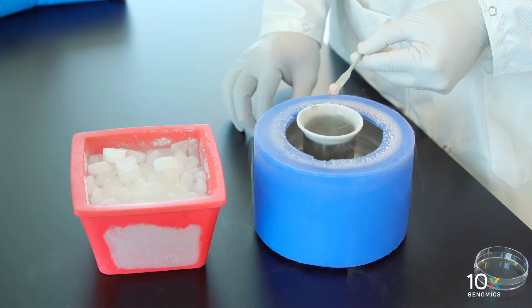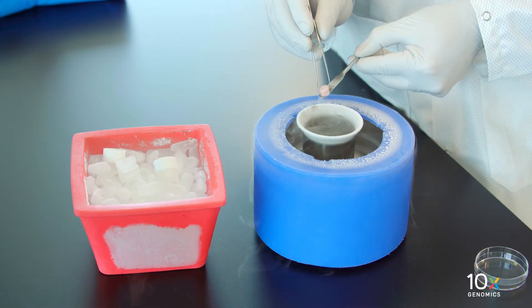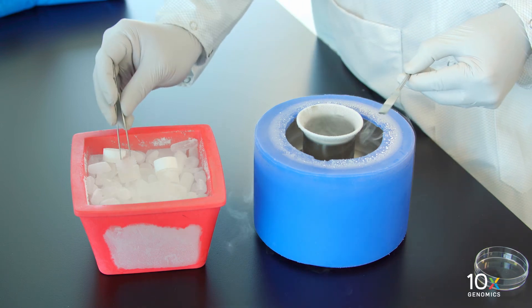Once frozen, transfer the tissue to a pre-cooled Wheaton cryo elite cryovial and place on dry ice.